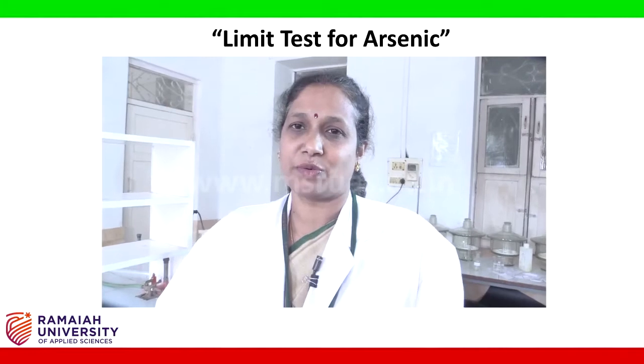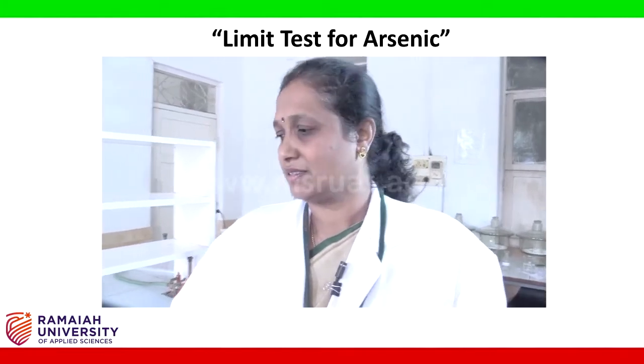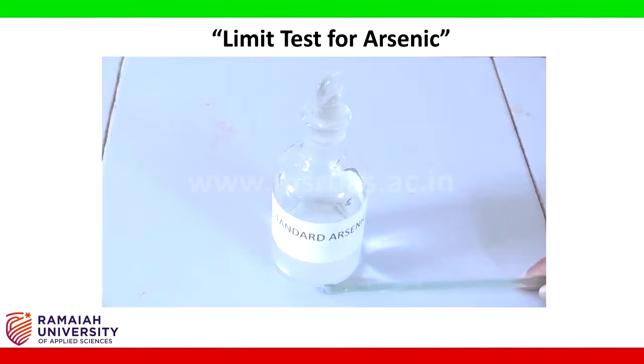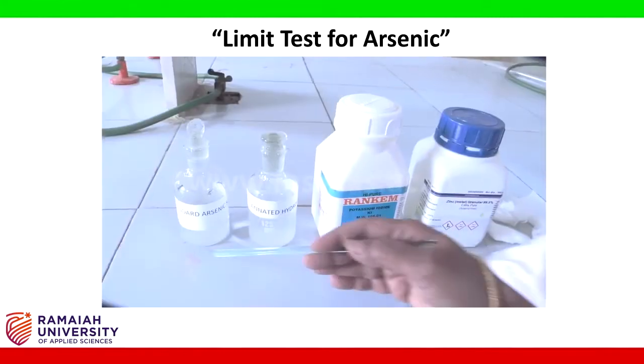The chemicals required for this experiment are standard arsenic solution, which is used for comparing with the sample solution to check whether it contains the arsenic impurity or not. It is prepared by taking arsenic trioxide, which contains 10 parts per million of arsenic in it.